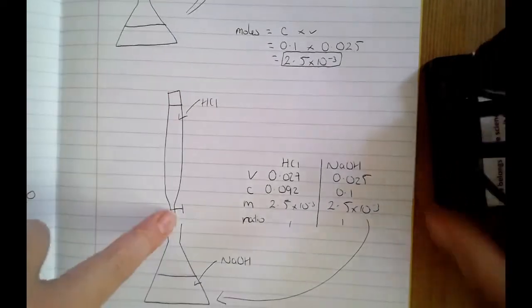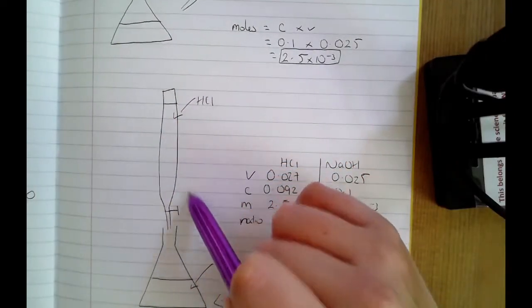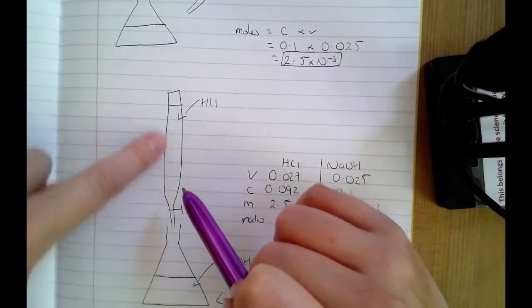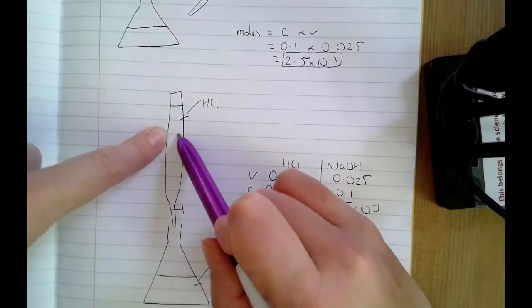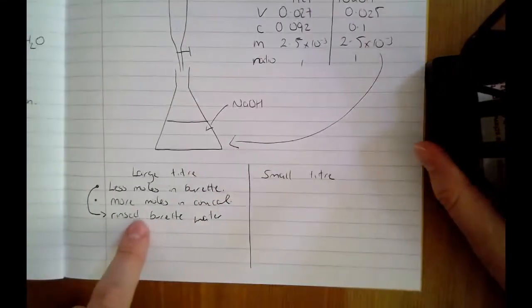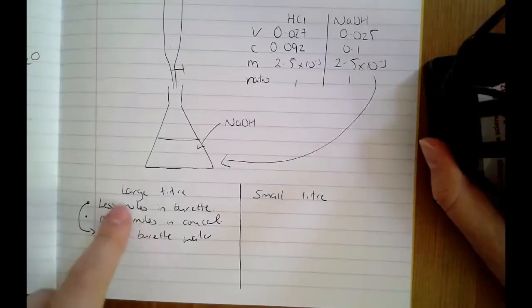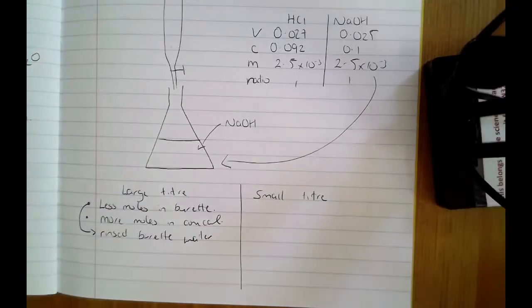If you rinse it through with water and you've got lots of droplets of water within your burette, when you close the tap and then start adding your HCl, you're not going to be able to get the full volume of HCl in there because you've already got droplets of water taking up space, and that water will dilute your HCl. So it's really important that if you've rinsed your burette with water, you then rinse it through with the solution it's about to contain. If you don't, you're going to end up with less moles in the burette than intended, and you're going to end up with a larger titre.